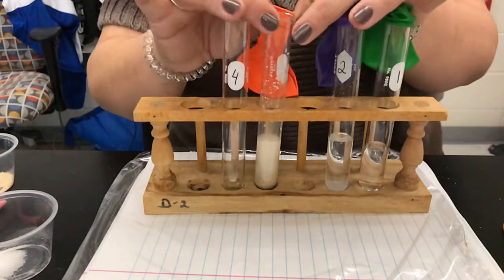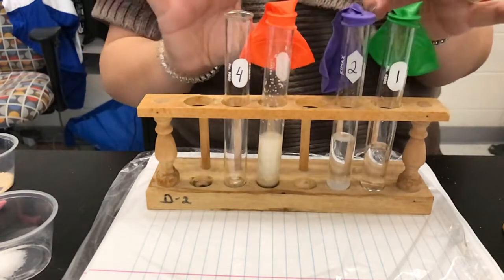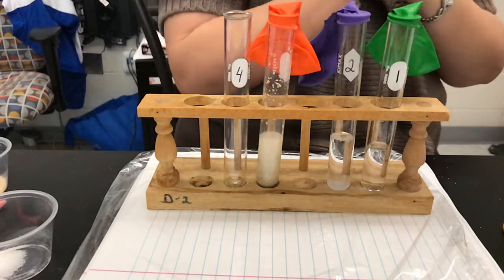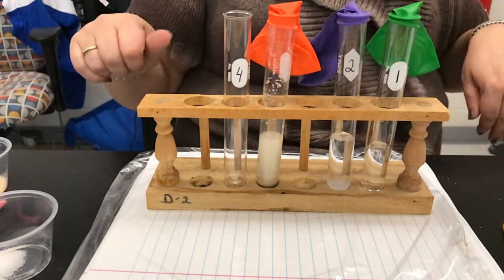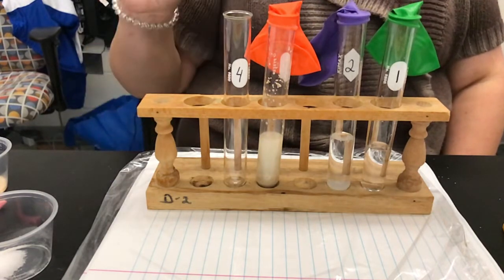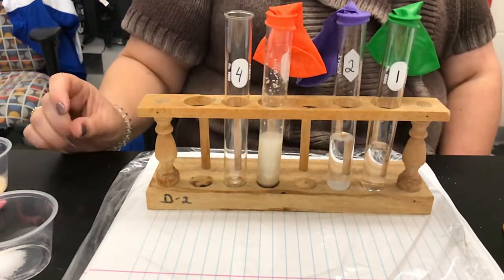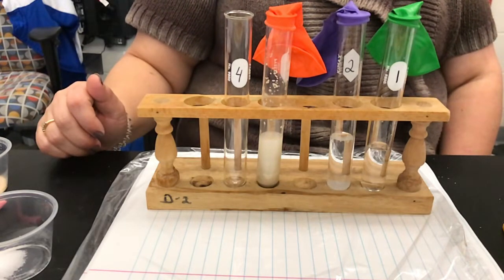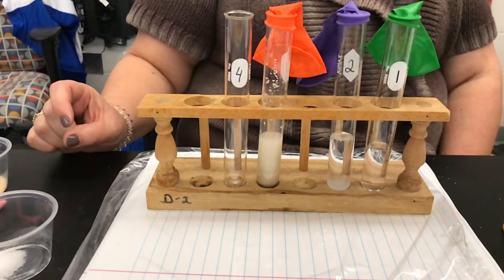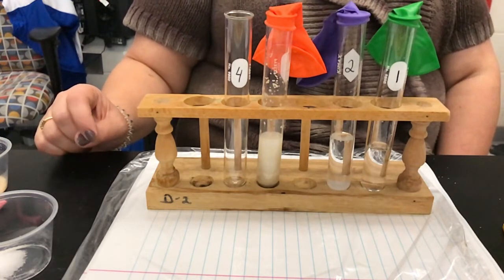At home, I do have a bread maker — actually that wouldn't be a science experiment that goes right with the yeast. So you should have written down for test tube three: 10 milliliters of water and one gram of yeast in your chart, under description of conditions. Test tube three: 10 milliliters of water and one gram of yeast.